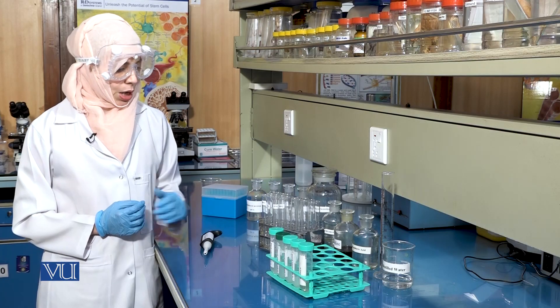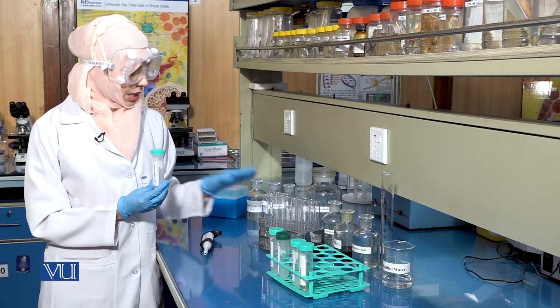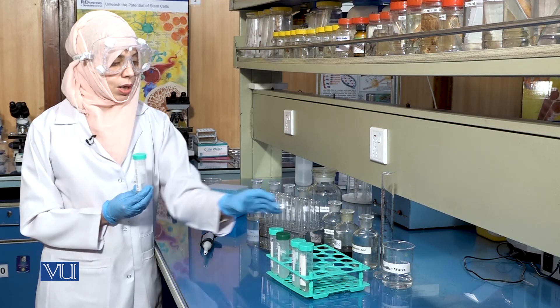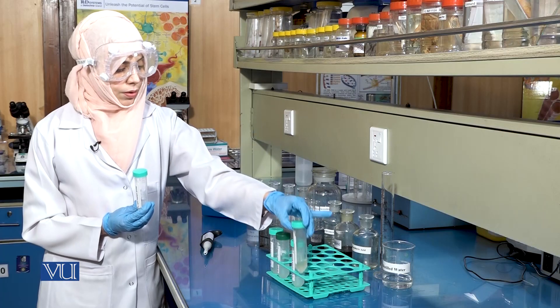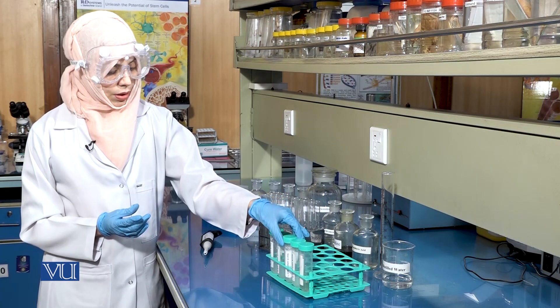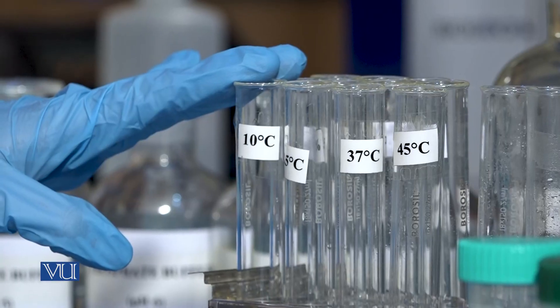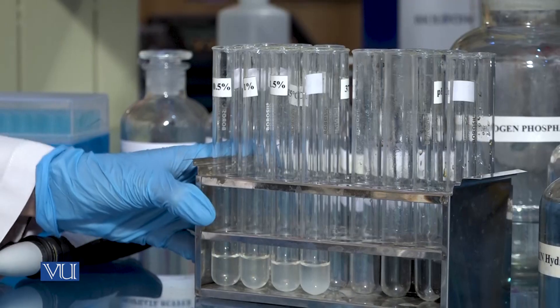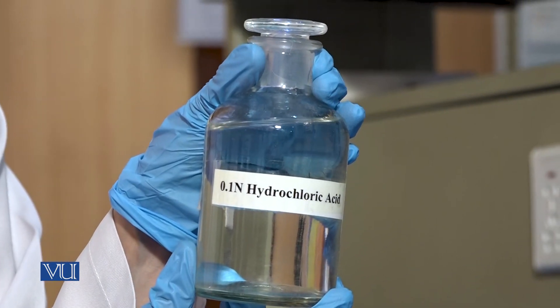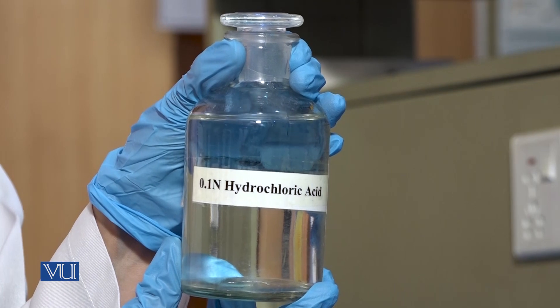To proceed with this experiment, we will take 2 ml of 1% starch solution in each test tube and add to it 1 ml of amylase solution. Then we will place each test tube at its designated temperature for 10 minutes. After 10 minutes, we will remove the test tubes from the incubator. Next, to each test tube, we will add 0.5 ml of 0.1 normal hydrochloric acid. HCl functions as a stopping solution here and inhibits enzyme activity.